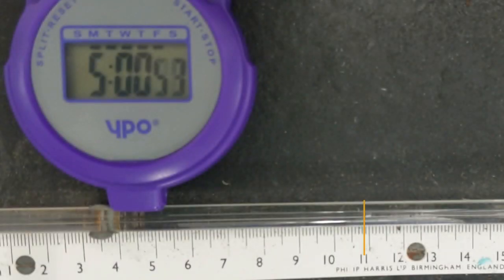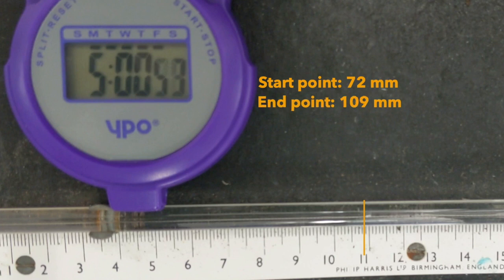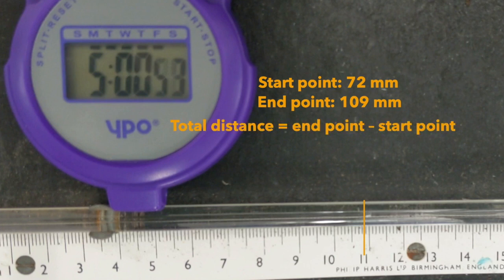After 5 minutes, the bubble was at 109mm along the ruler. Again, let's calculate the total distance travelled by the bubble. The start point this time was 72mm and the end point was 109mm. Again, to find the total distance, you need to subtract the start point from the end point. So for this one, that is 109 minus 72, giving us a total distance moved of 37mm. So a slightly greater distance this time. We'll record this value and use it later to calculate the rate of transpiration.